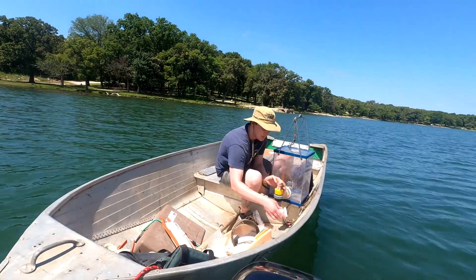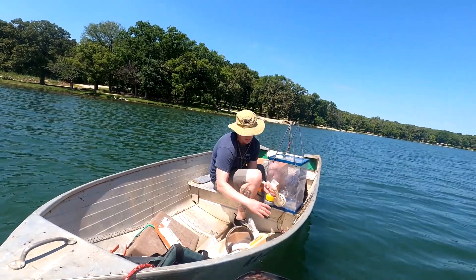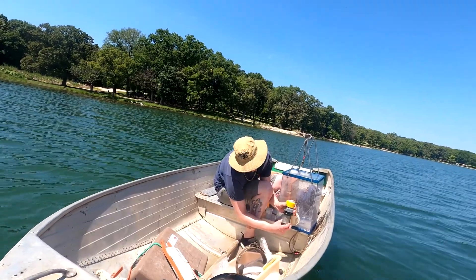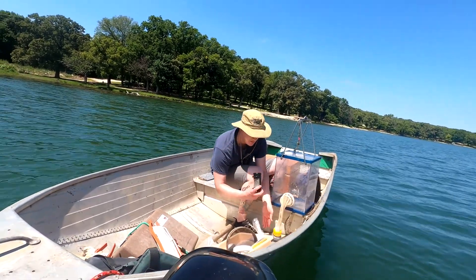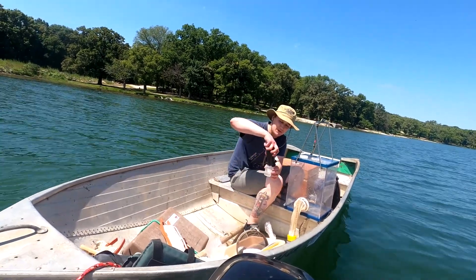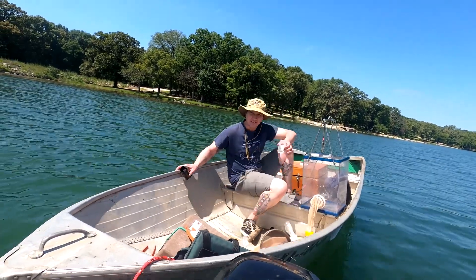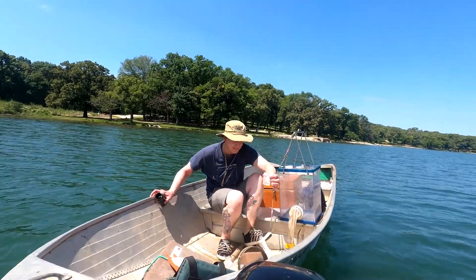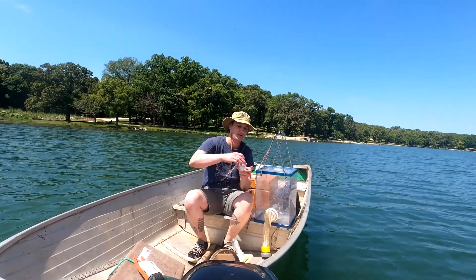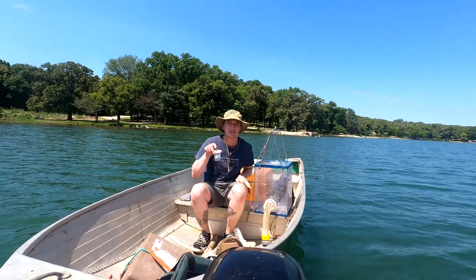I'm going to pull that up and I've got another container ready here. I'm going to undo this black portion on the bottom of the net and pour it into our vial. Then I'll just cap this right here — it'll be good to go after a little bit of preservative.